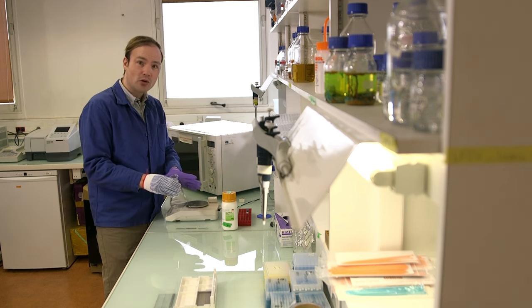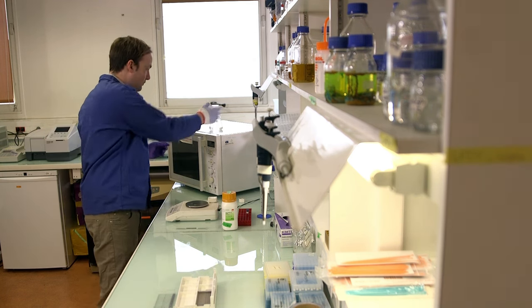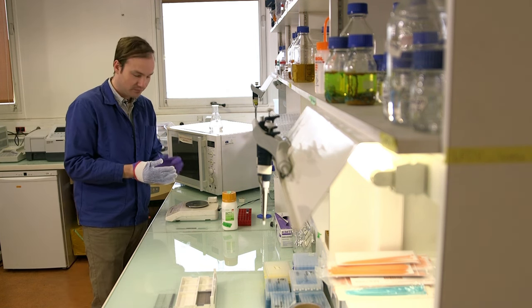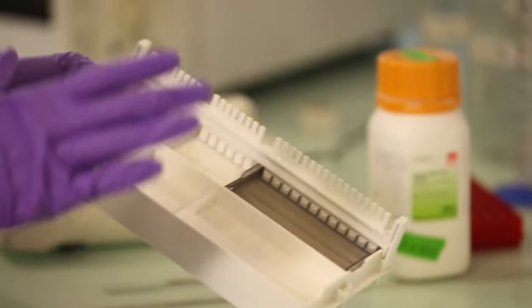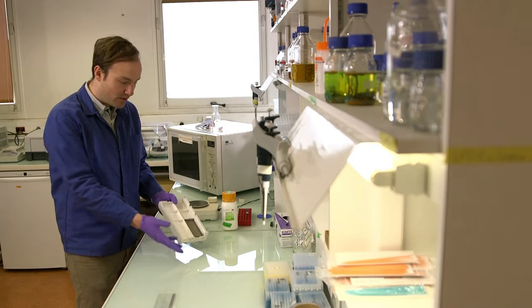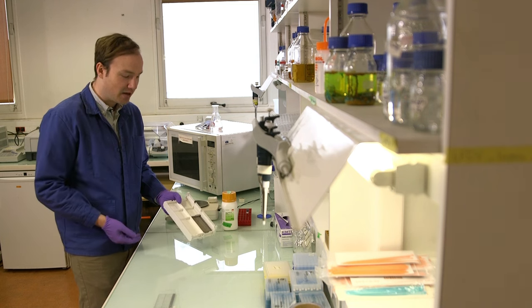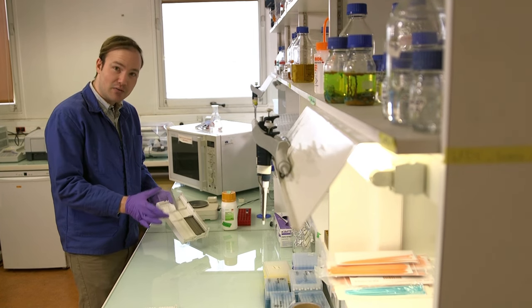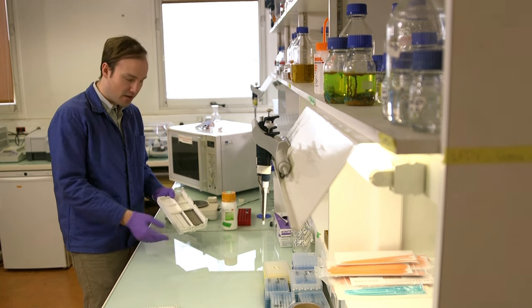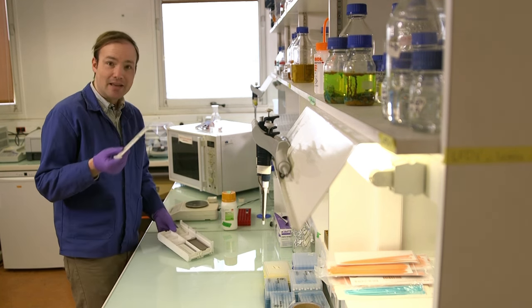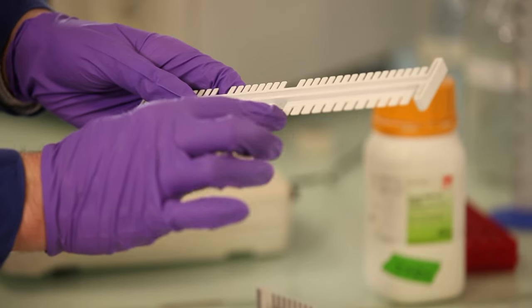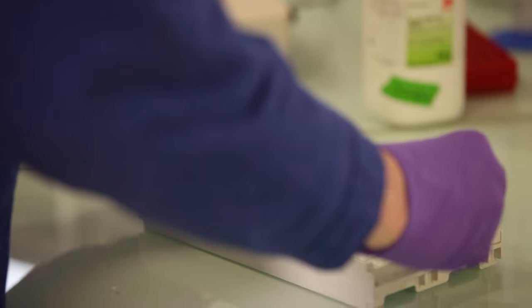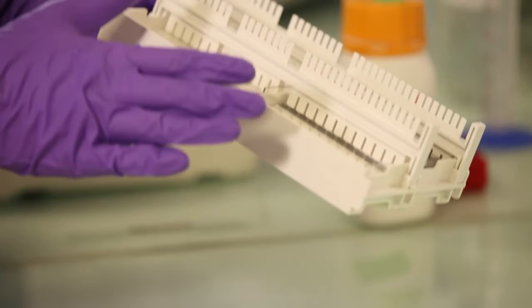So this is a bit too hot to work with right now. I'm going to set this aside to cool and while it's cooling, I'm going to prepare my mold for the gel. So here's an example of the molds that we use in this lab. It's nothing but a rectangular piece of plastic that I can pour the agarose into. This mold also comes with a tray that's going to physically hold the gel. And then a comb. The comb goes on top of the mold and it creates these little wells, these little slots where we can add our DNA to the gel itself. And that's it, that's ready to pour.